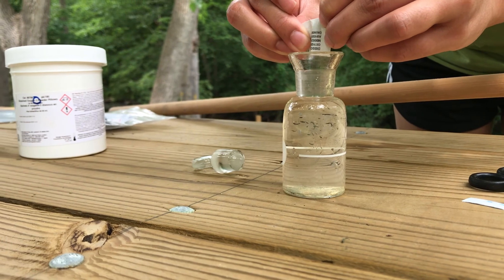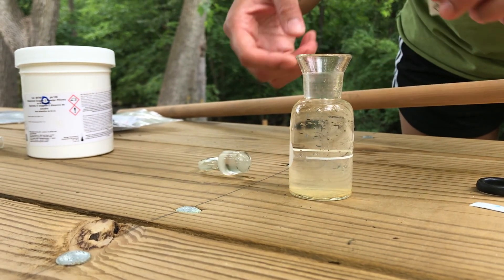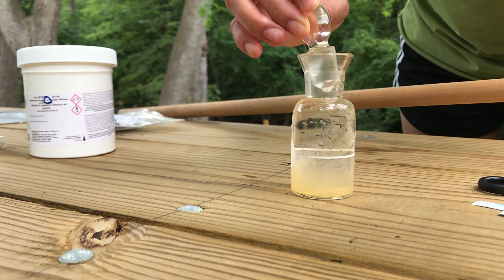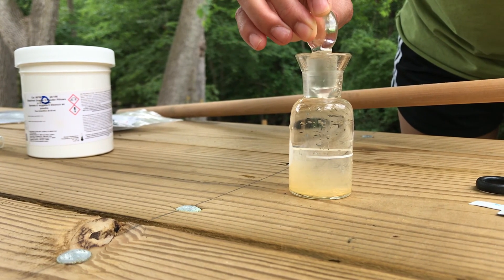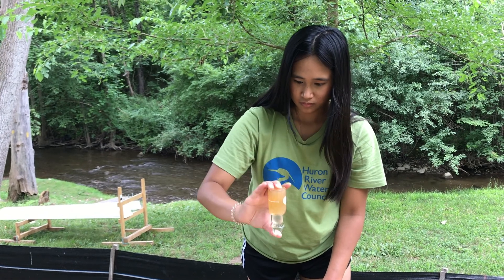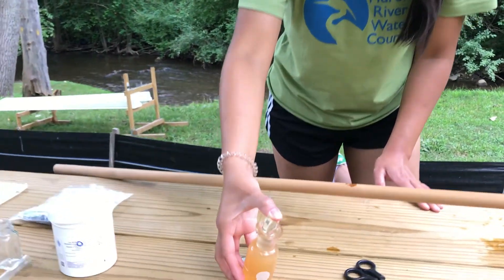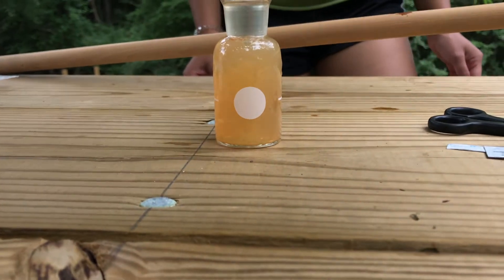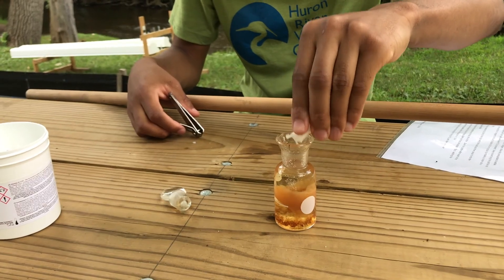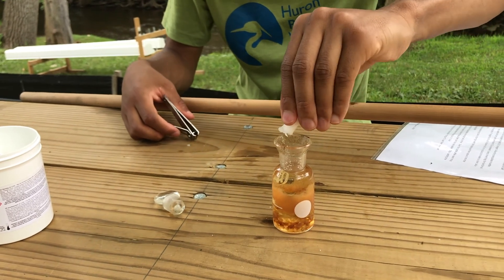Anna started by adding two reagents. After shaking the bottle, she will let it settle two times. After the second settle, we add a third reagent.